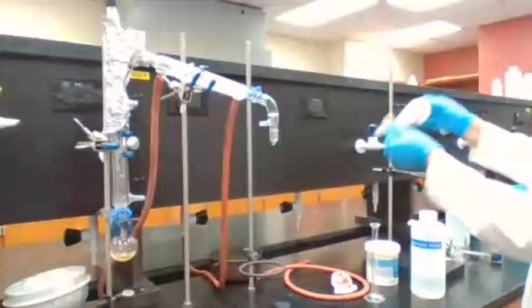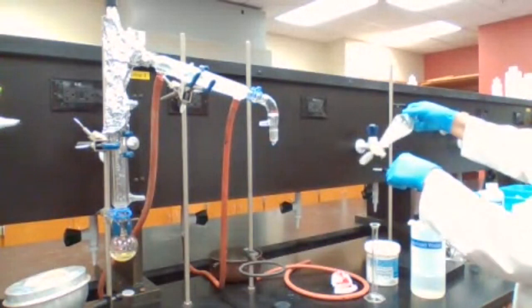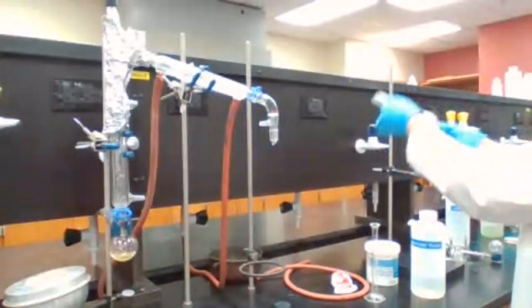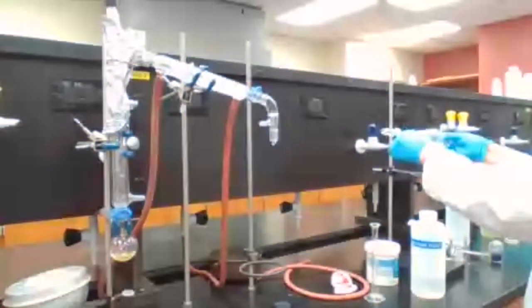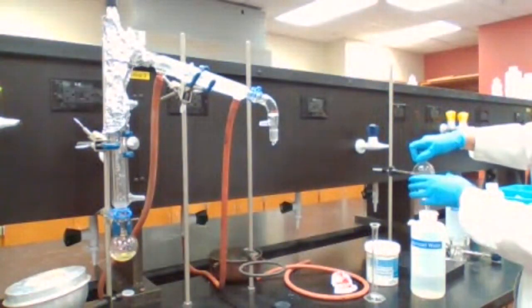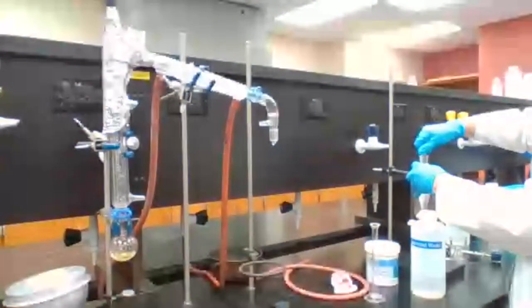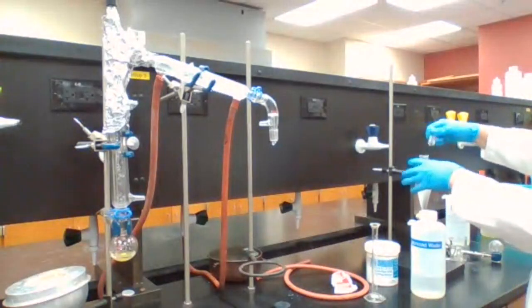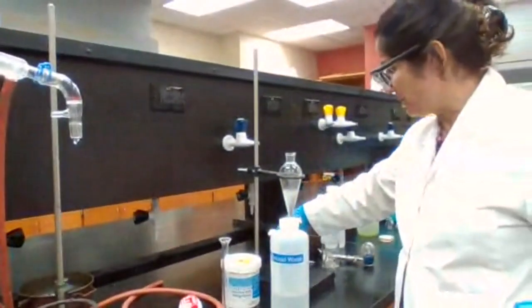I have to mix it because I want to make sure that I'm washing the solution. There's no gas unless I shake it too hard, then the cyclohexene is going to vaporize and create gas, but there is no reaction that generates gas. It doesn't have too much pressure.